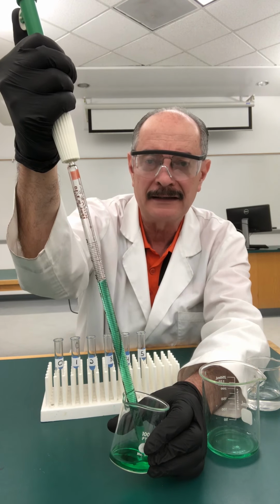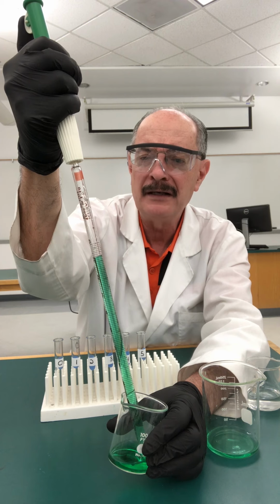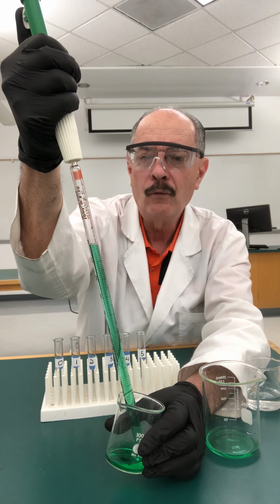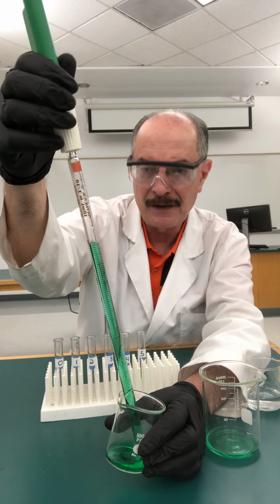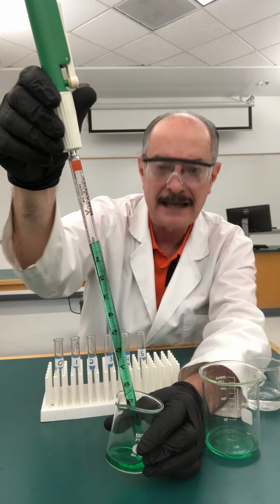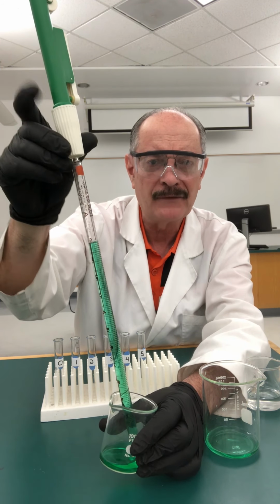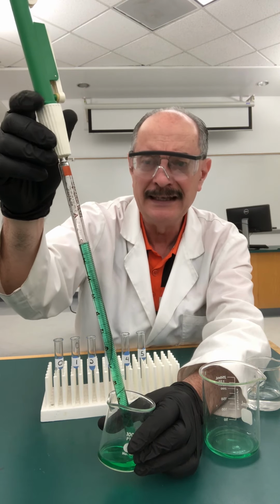I'm going to see how far I can take it here because I want to go a few tenths of a milliliter above 0 if possible. That way, when I turn the pipette over, well, that's as far as it'll go. It went exactly to 0. It's not going to help me a lot because when I pull this out and put my finger on, it's going to lose some liquid.